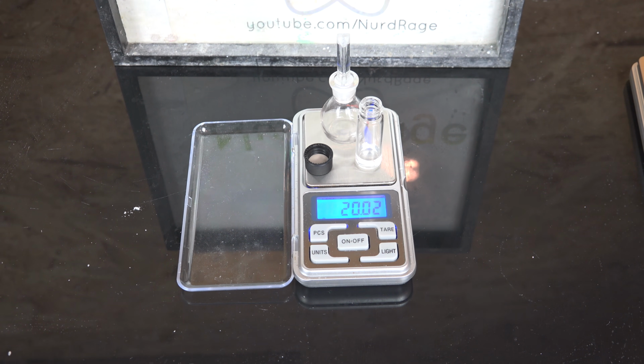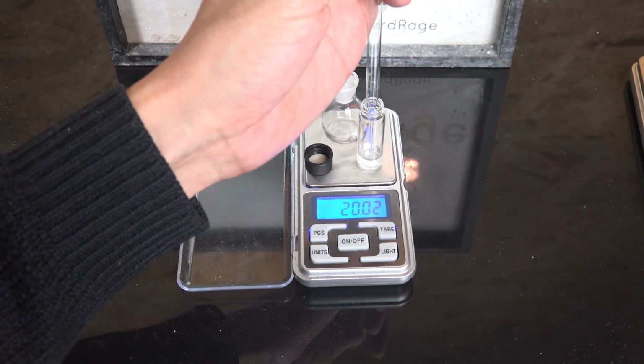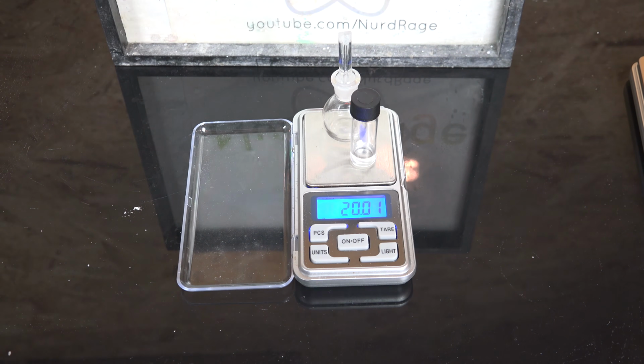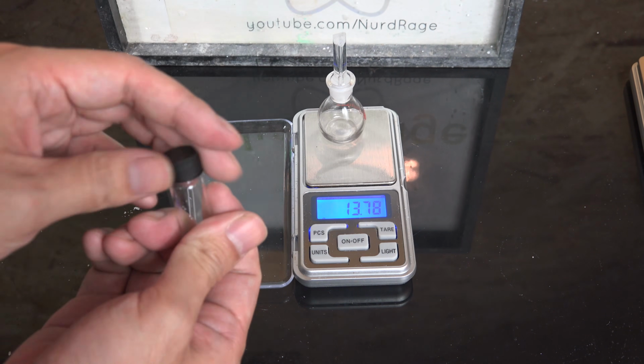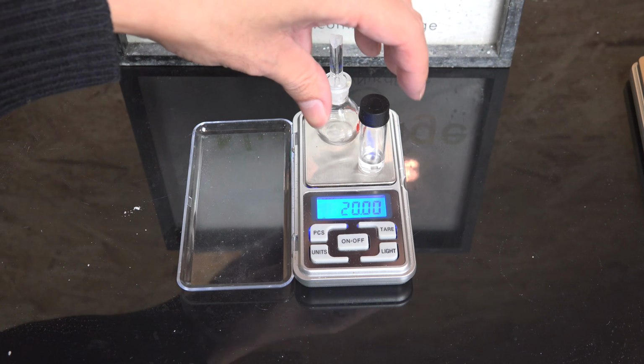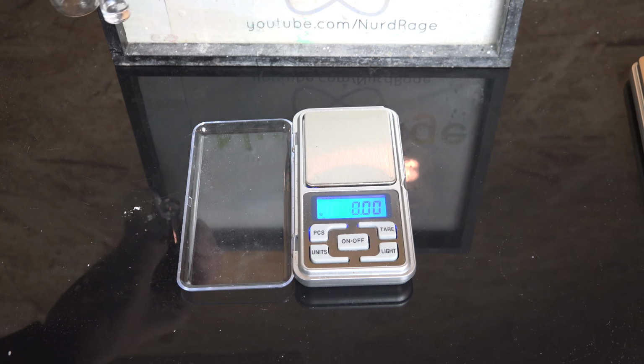It was nothing more than a vial where I add a small amount of water so it would complement the mass of the empty pycnometer. The total mass was now a simple number with only one significant figure. This number was simple enough that I could subtract in my head rather than use a calculator, and made the tedium of doing 500 samples a little easier.